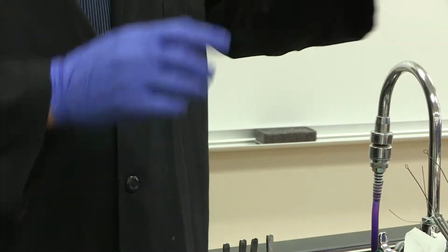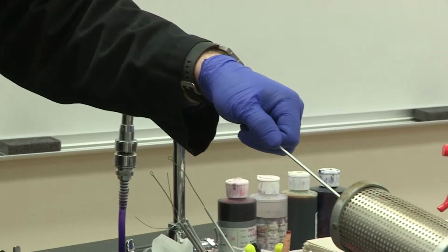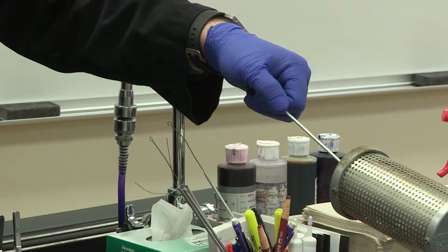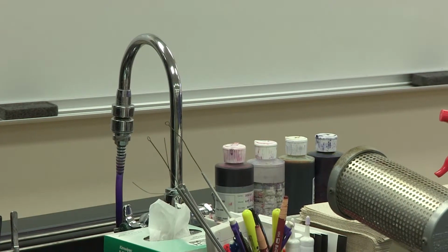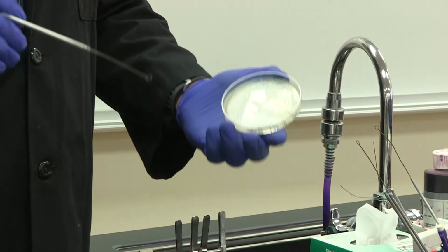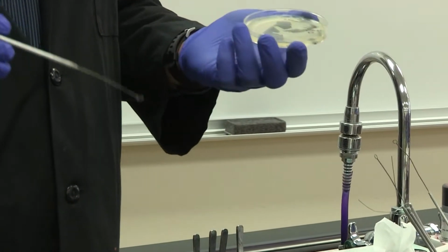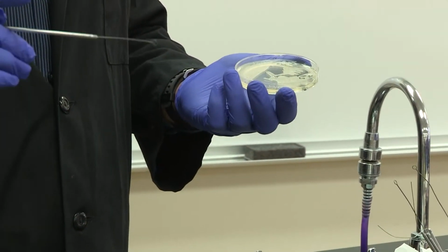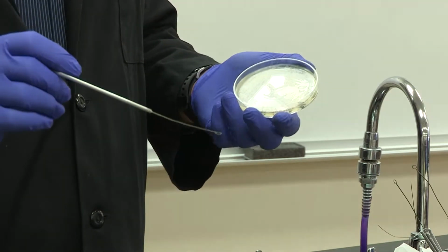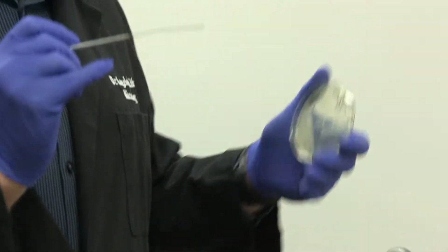So again, we're going to use our loop for this. We're going to make sure that we sterilize our loop for about 5 seconds. It'll come out nice and red hot. You want to let that cool down for about 10 seconds. And what you're going to do, again, is you're going to just select a single colony. It's very important that you don't use too much, because if you use too much, when you look at this under the microscope, it's going to be too crowded for you to see anything. So again, just take a small dab of bacteria into a colony.